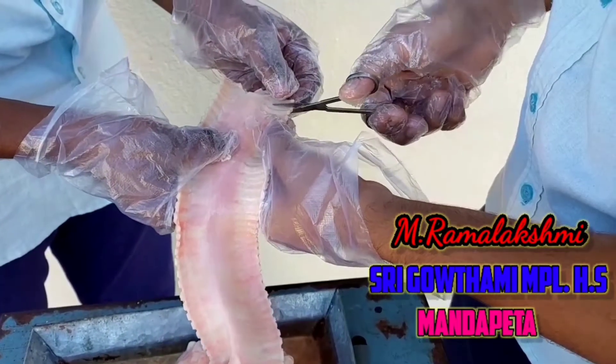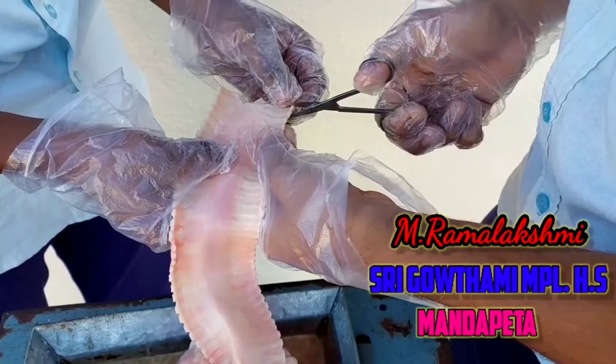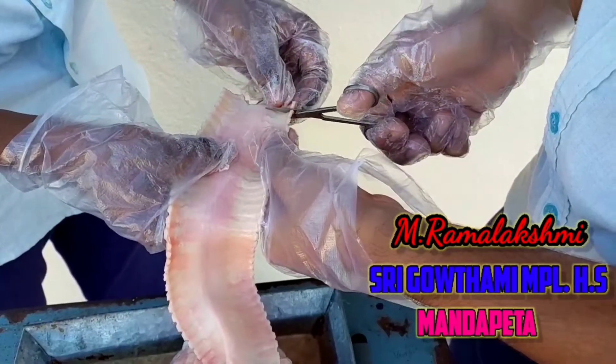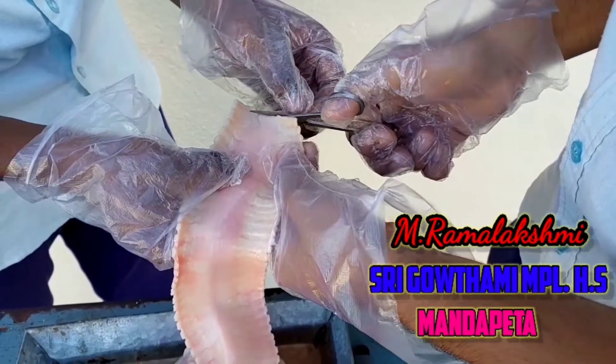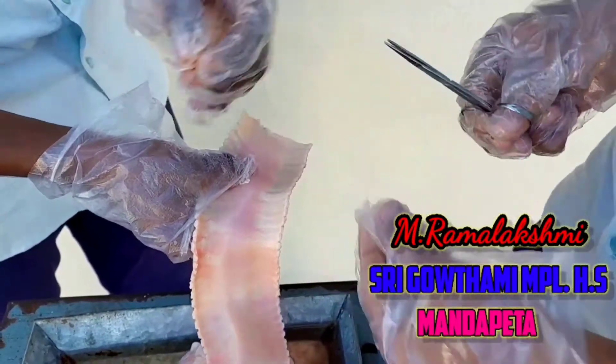Now let us observe C-shaped cartilaginous rings in trachea. These rings prevent the trachea from collapsing.